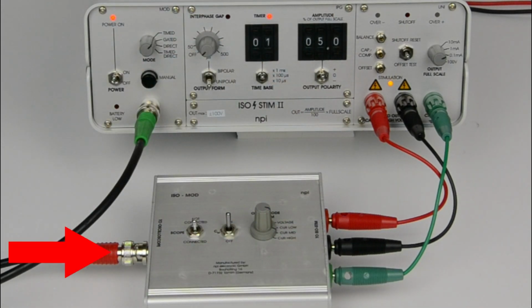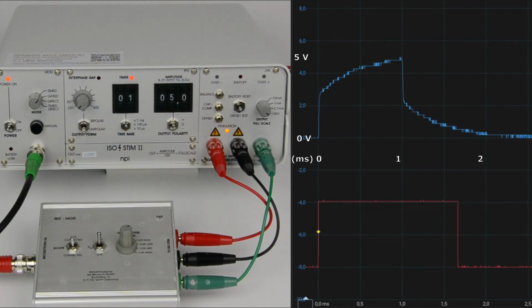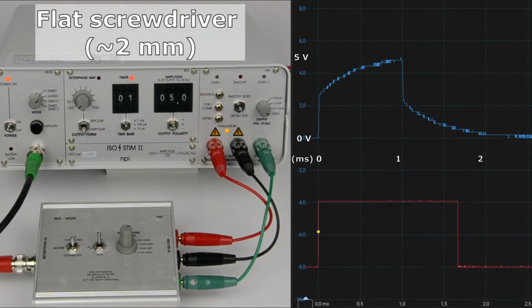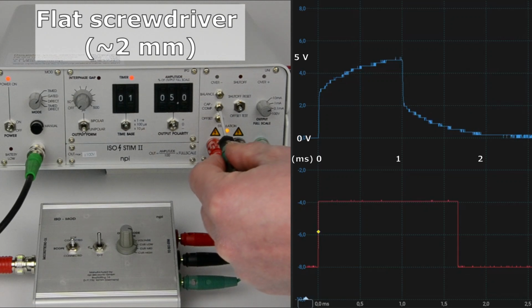Now we monitor the output signal from the model cell and use a flat screwdriver to adjust capacity compensation. With the compensation at a minimum, the signal will look rounded at the beginning of the pulse. Increasing compensation will make this signal look more rectangular.